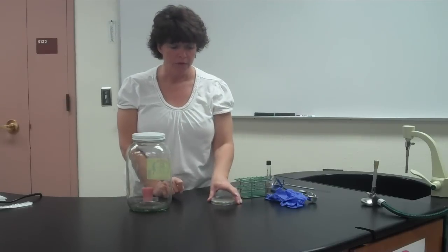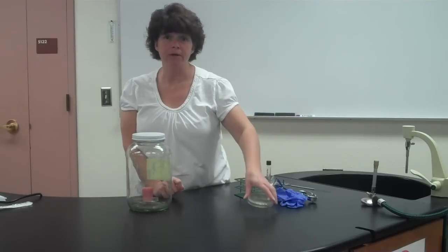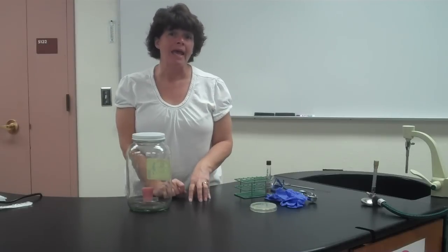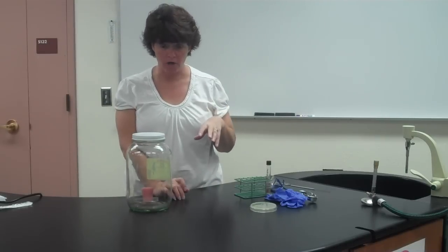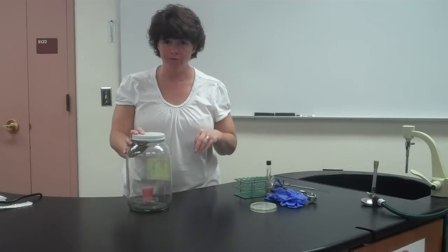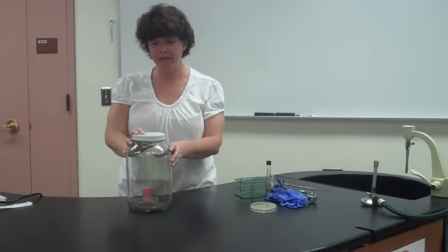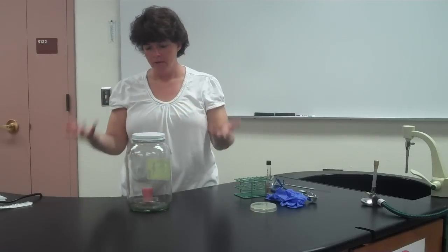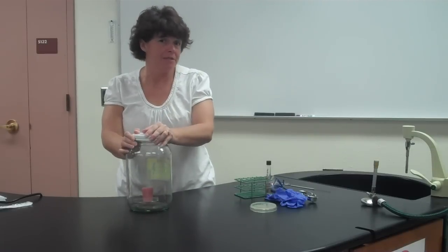The two plates grown aerobically go in the incubator inverted as usual. The two plates grown anaerobically go on the little desk by the cart where I'll have the candle jar. Leave them on the desk, and when I have plates from all groups, I'll put them in the candle jar, light the match, close the jar, and hopefully when the candle goes out most of the oxygen is gone. It's not the best method but it's the only one we have.